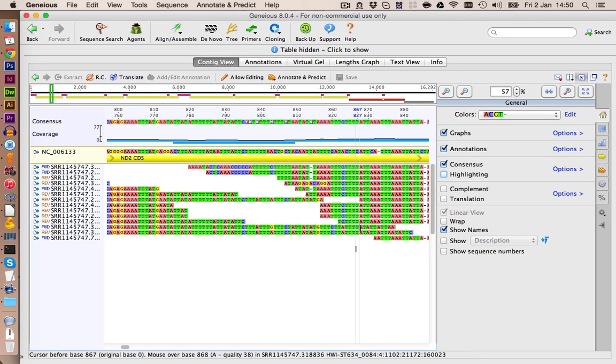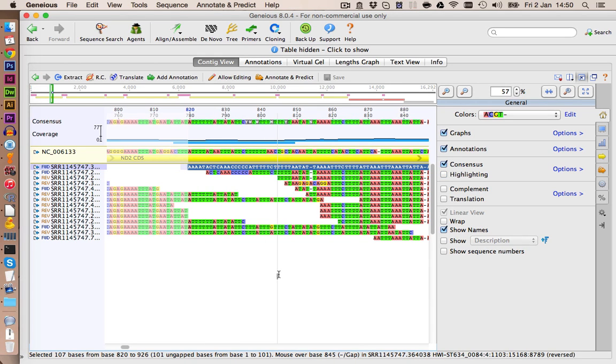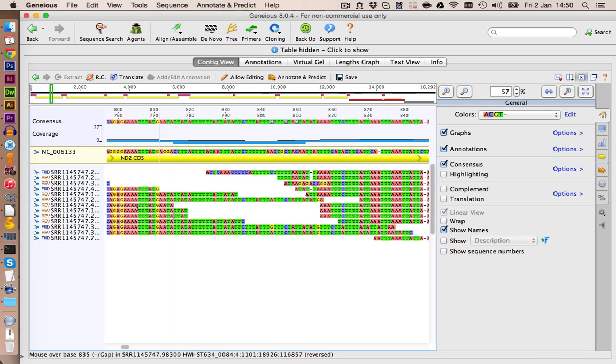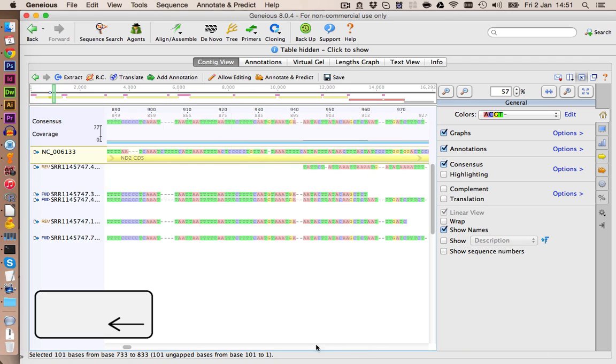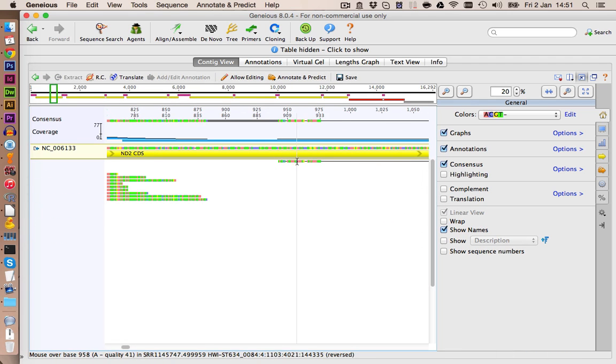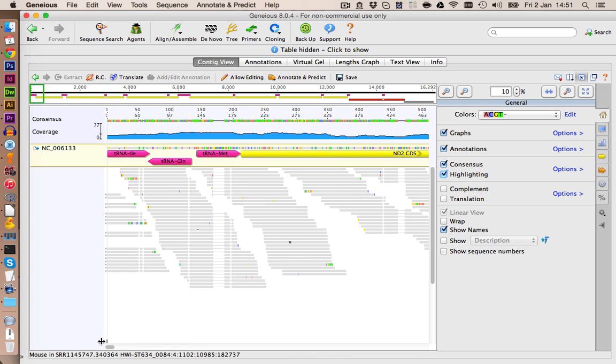So it's important to check your draft genome at every assembly step. If you want to delete sequences, just select them and click on delete. Also, this one doesn't look right. So you see this now looks a bit better. Okay, let's now check the complete genome to see if we find any other errors.